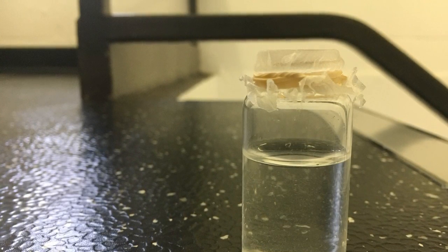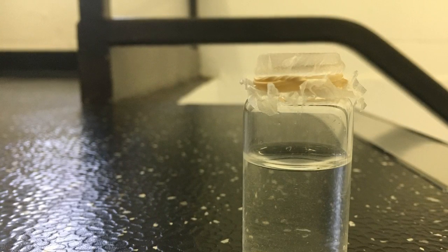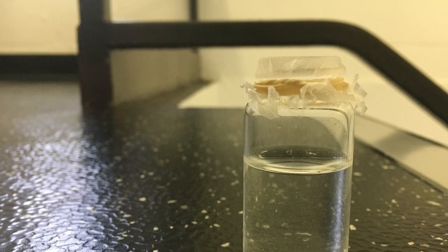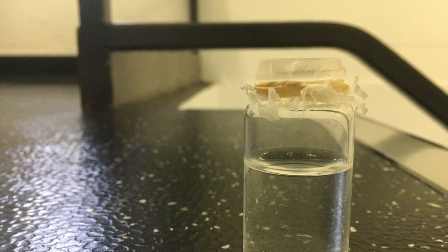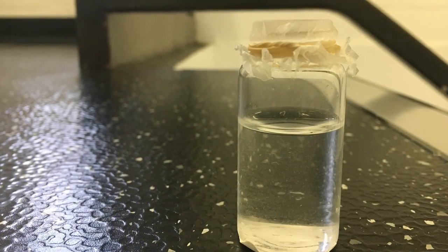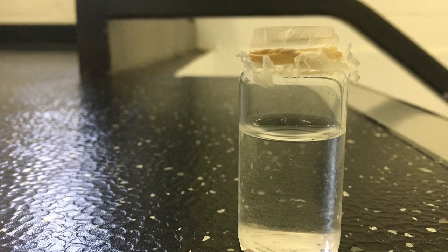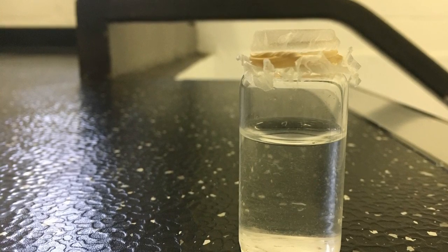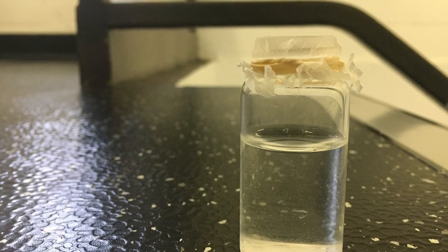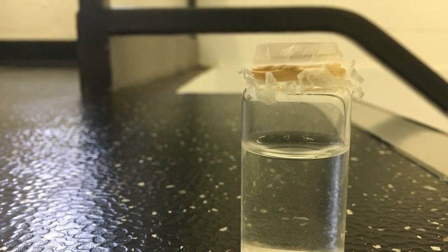Another way to grow crystals, according to sciencenotes.org, is to use a seed crystal. In order to do this, you must pour a small amount of saturated salt solution onto a watch glass, and as the liquid evaporates, crystals will start to form. Use one of these crystals from this dish, and then pour the supersaturated salt solution into a clean container. Allow the solution to cool, then hang the seed crystal in the solution from a string attached to a pencil placed across the top of the container.